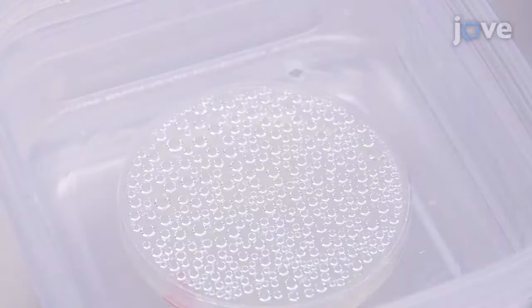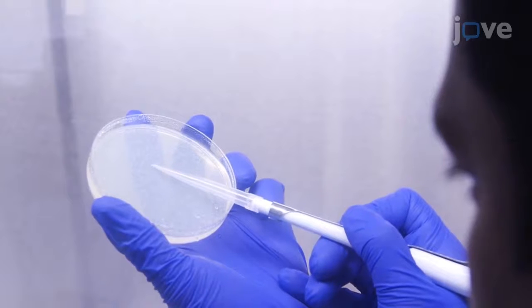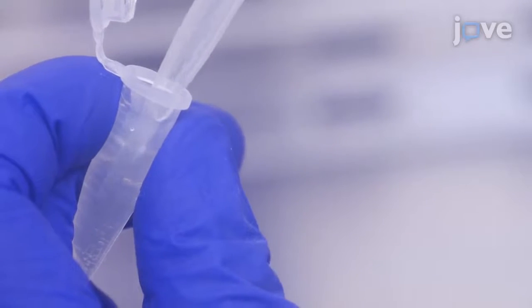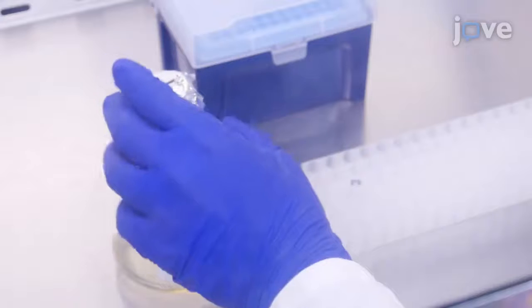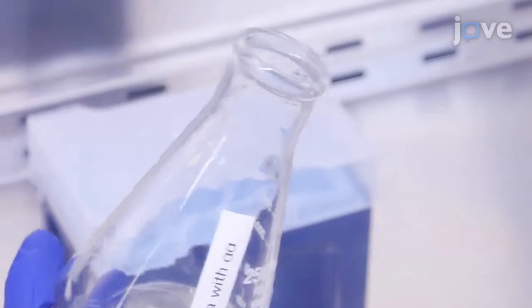After the incubation period is over, use a sterile pipette tip to collect amoeba spores from half of the plate. Then pipette up and down to resuspend the amoeba on the pipette tip in 1 milliliter of PS medium. Transfer the inoculate mixture to a 250 milliliter flask with 25 milliliters of PS medium supplemented with antibiotic antimycotic solution.